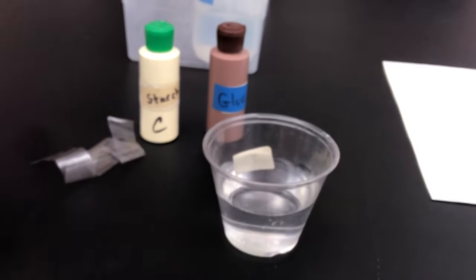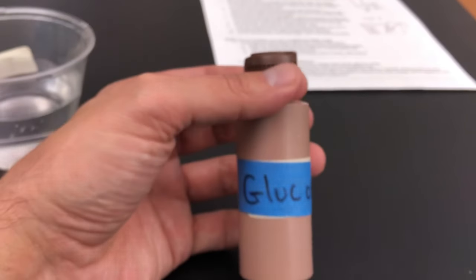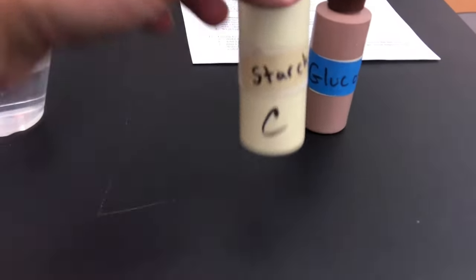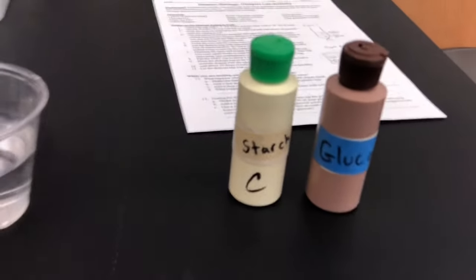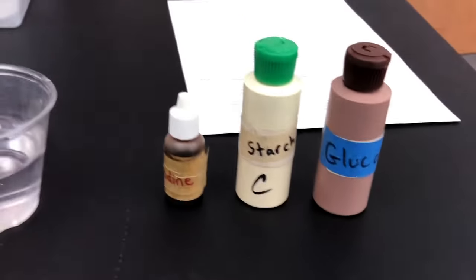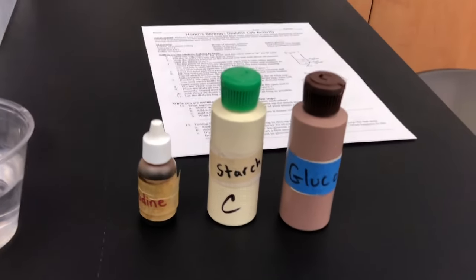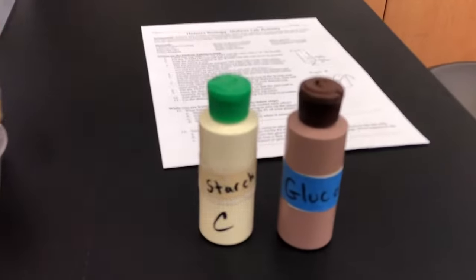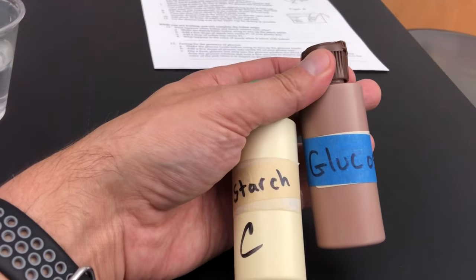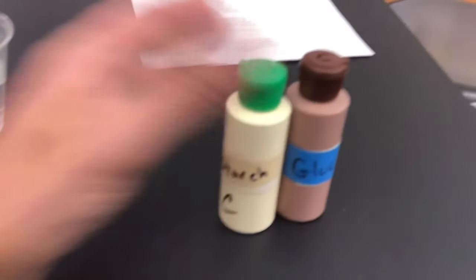Ultimately, what we're going to try to figure out is: this is a bottle of glucose — can glucose pass through the dialysis membrane? This is a bottle of starch — can starch pass through the dialysis membrane? And this is a dropper filled with iodine — can iodine pass through the dialysis membrane? I'm going to pause the video and fill a dialysis membrane with five milliliters of starch and five milliliters of glucose. I'll be right back.